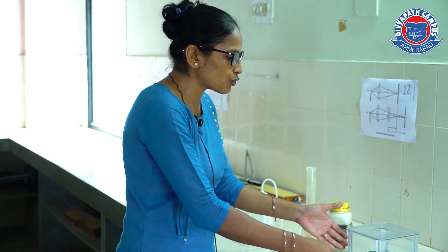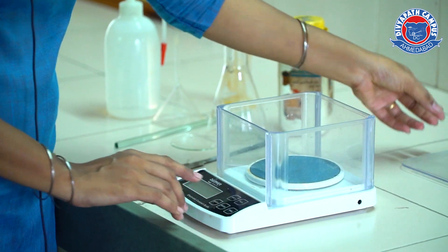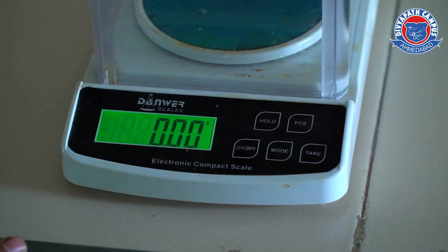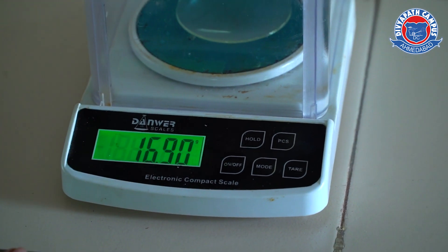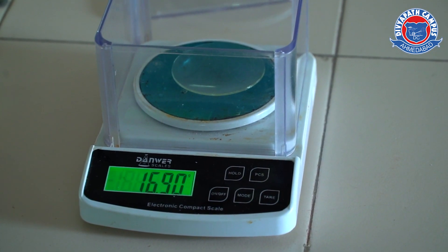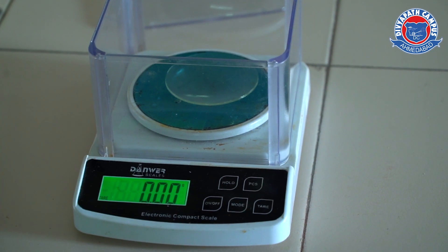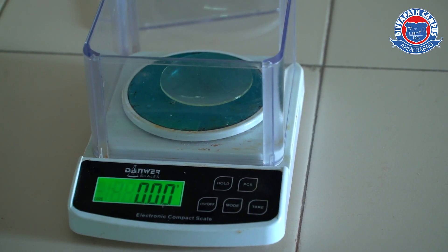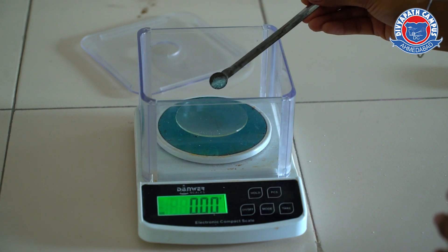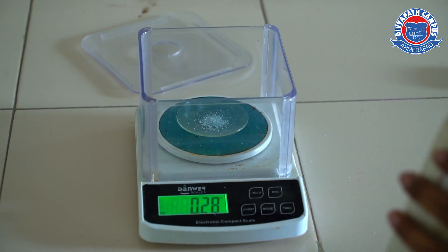Now, first of all, we will take the weighing balance and start it. Then we will place the watch glass inside it. You can see it will measure the weight of the watch glass, so we will tare it and neglect the weight of the watch glass. Now we will slowly transfer 1.26 grams of oxalic acid powder inside the watch glass.